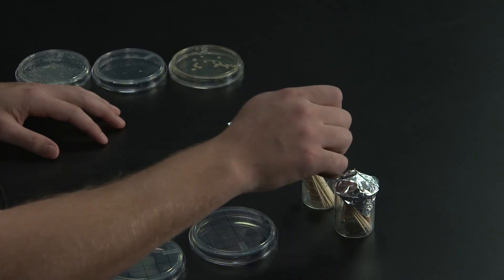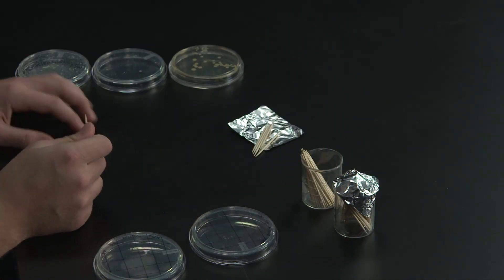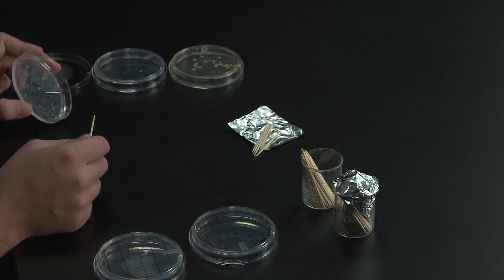Discard the toothpick with each pick and continue transferring until you fill every grid space on the new petri dish.